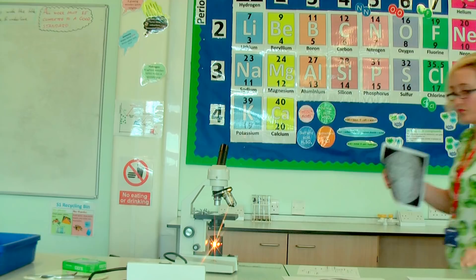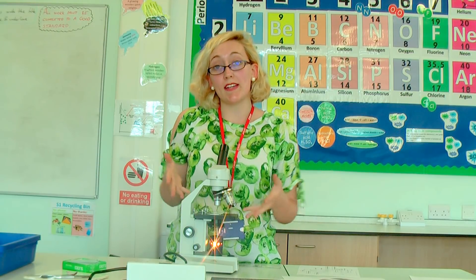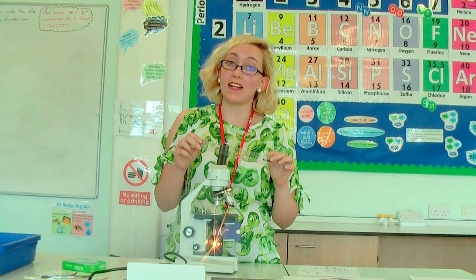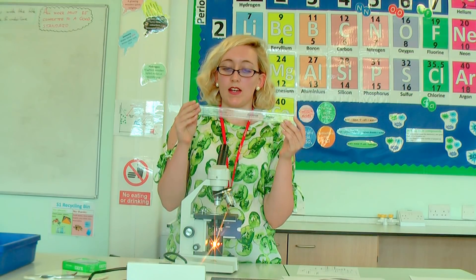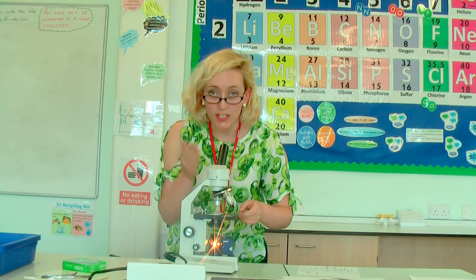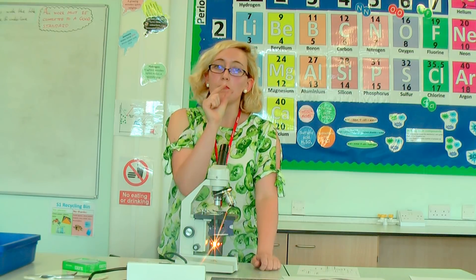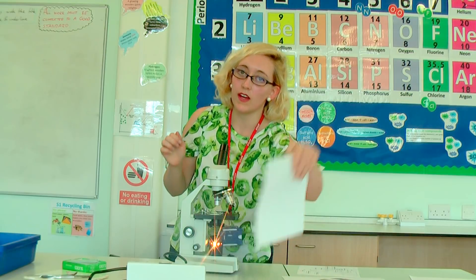You can also see in this one that there are these lines — that's because part of the reason for doing this practical is so that we can draw cells properly. The other reason is that we need to be able to calculate the length of cells and calculate scale. This is where your perspex ruler comes in handy. Take your perspex ruler and slot it under the microscope next to your slide, so that when you look down the lens you can see both the cells and the ruler. Place the ruler so that you can see one millimetre width.